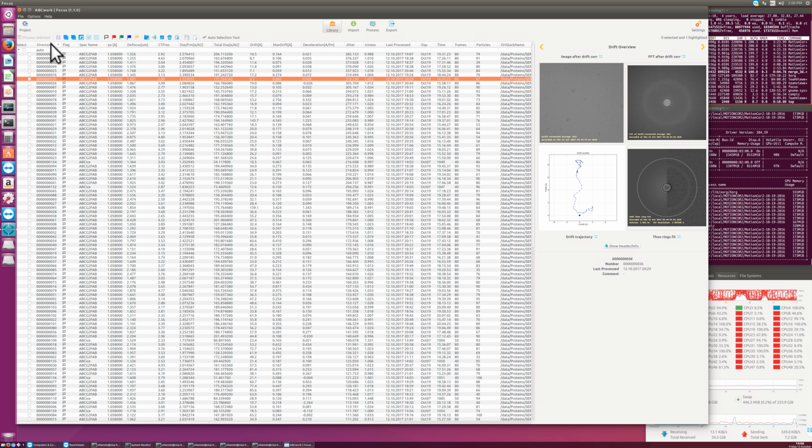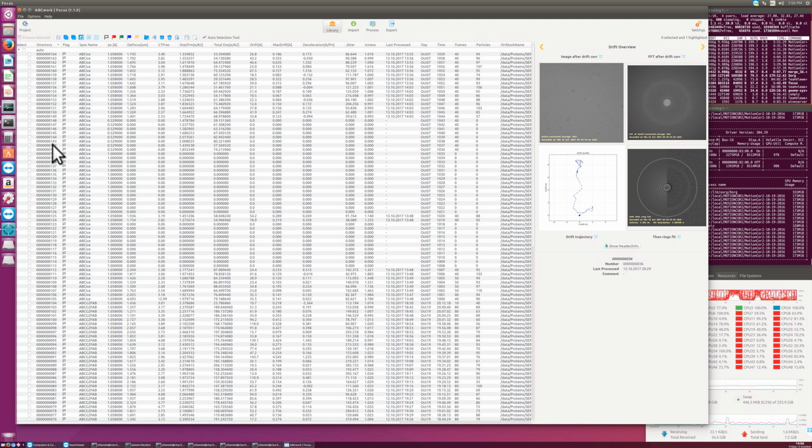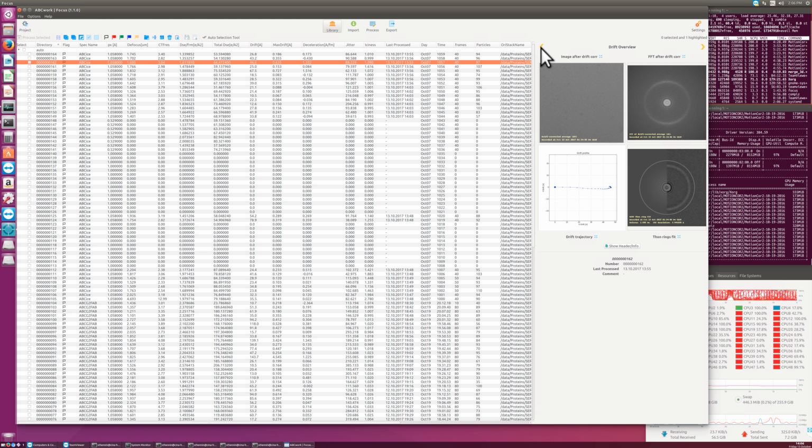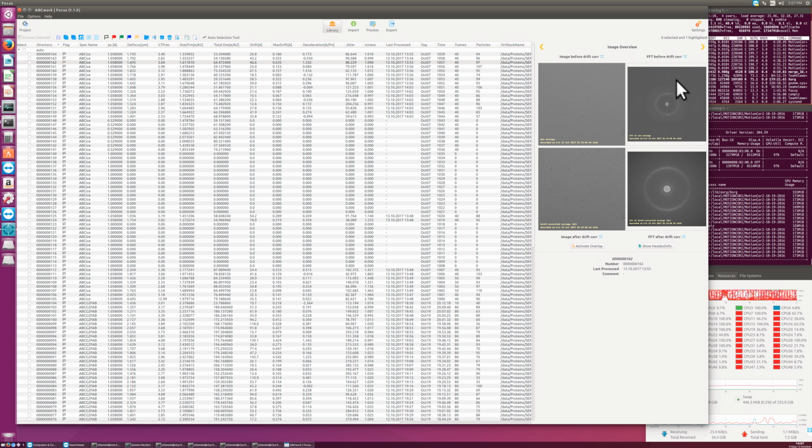And in the library they usually are imported, and they get some folder name which has a sequential number. So the last ones imported are up here, 164. And these new images have also 8K dimensions, but only 40 frames. Here are some 50 frames, and the older ones were 80 frames. And then afterwards they are cropped down to 4K.